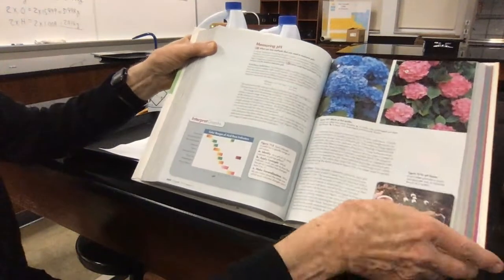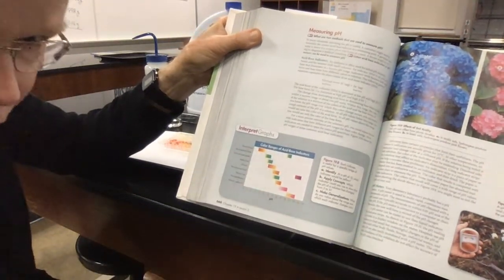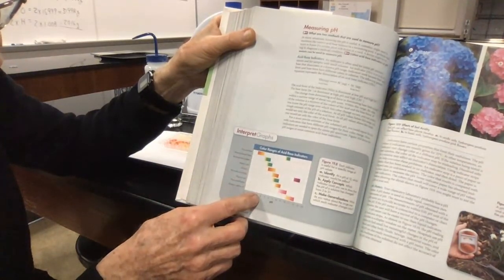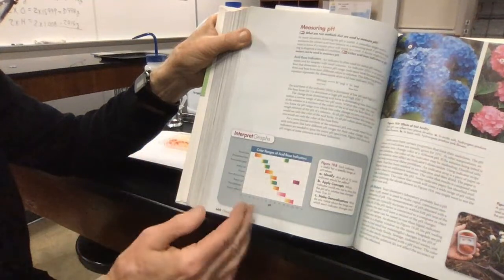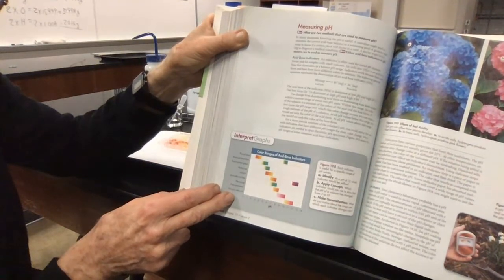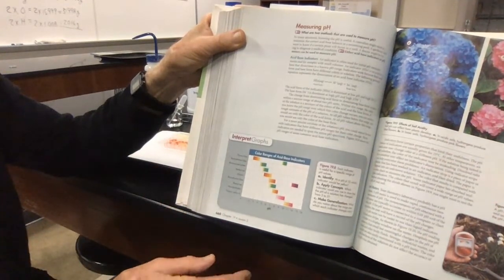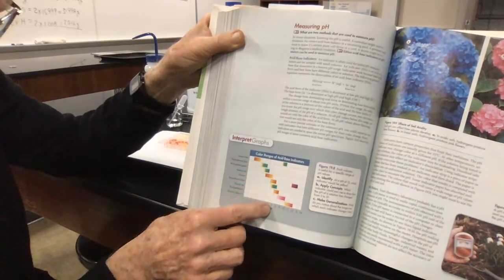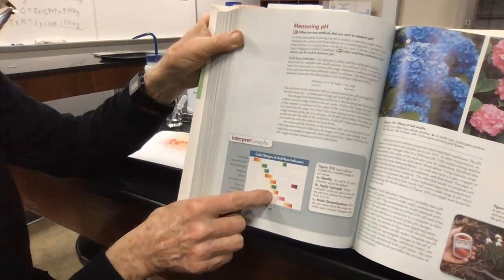The last thing I want to show you on page 660 is a chart down towards the bottom that shows us all the different ranges of color for a whole series of acid-base indicators, not just one or two. They're very similar to what I've done here, so you can actually look at the chart, see the pH, and look at the vertical column and see the names of the indicators. So it gives you a sense of how we can use indicators to determine where pH switches over. Here's a column of pH of 7. So if I wanted something that was going to change color at the neutral condition, I would pick probably one of these 3 indicators that you see right in here.